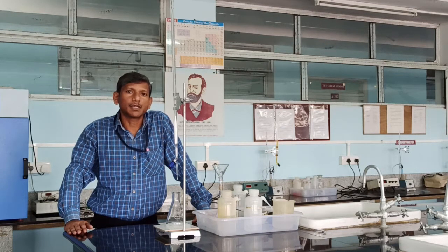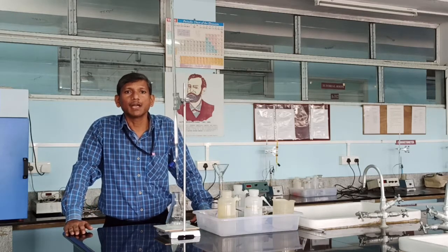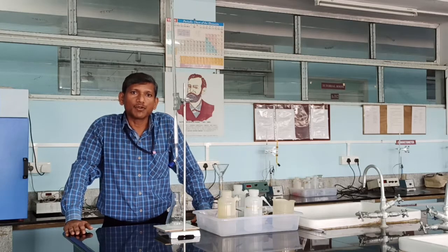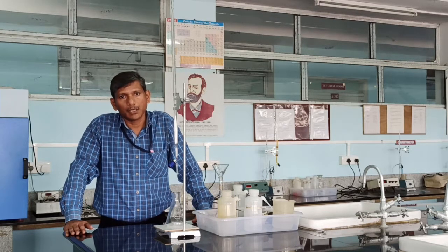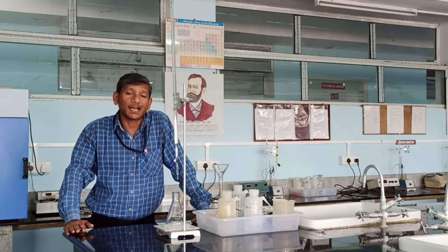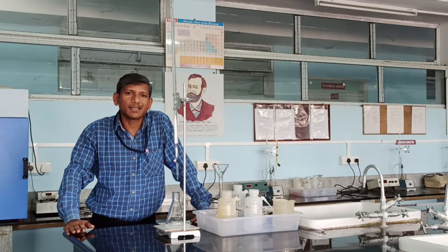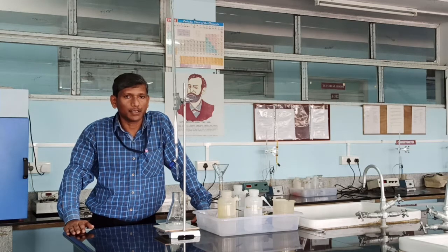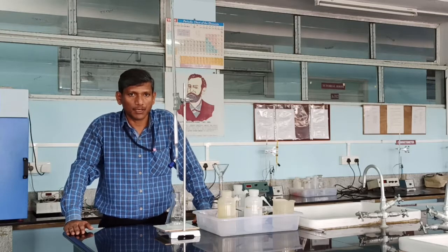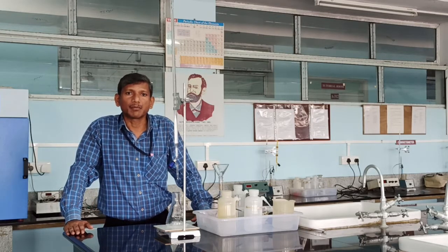Temporary hard water is due to the presence of bicarbonates of calcium and magnesium. This hardness can be removed merely by boiling. Permanent hard water is due to the presence of chlorides and sulfates of calcium and magnesium. This hardness cannot be removed by boiling. Our experiment is the estimation of total hardness of water, meaning the sum of temporary and permanent hardness.